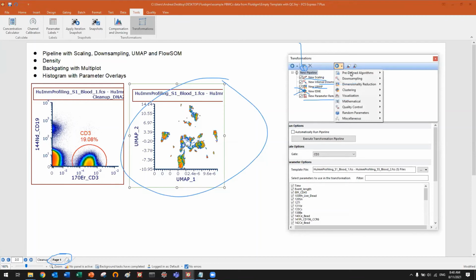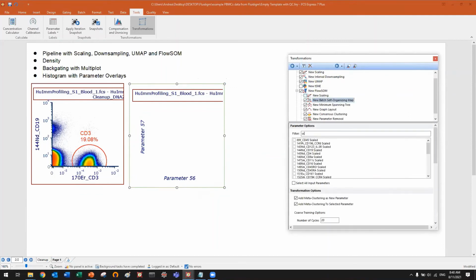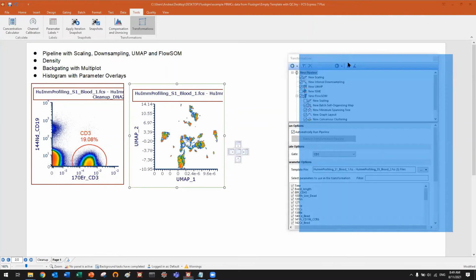I want to show you also FlowSOM, which is really cool. I will bring FlowSOM right before the parameter removal, and I will run FlowSOM on the same scaled parameters as UMAP. So we will compare apples and pears. I don't need the second parameter removal, and let's go back here. I will access UMAP, but I will also access FlowSOM. You can access UMAP, FlowSOM, t-SNE, SPADE, everything.